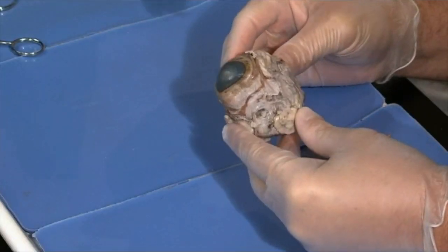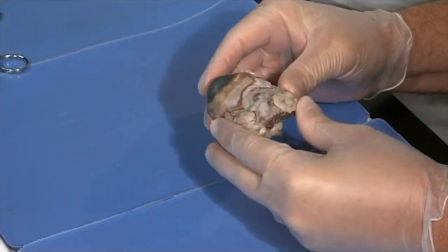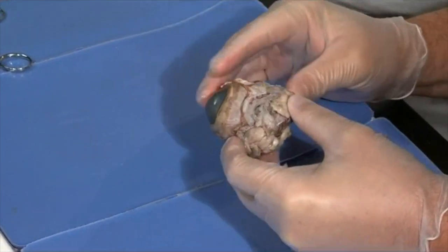Absolutely. I mean, the size is unbelievable. Yeah, they're very large. And this looks huge. Why does it look so big? Well, this one looks so big because, unfortunately, when they take them out, they're covered with fat and connective tissue. The eyeball itself is sort of embedded within all of this fat. So we'll have to cut a lot of this away.